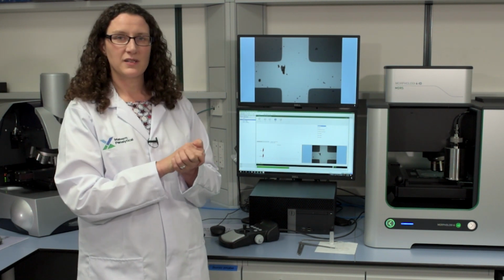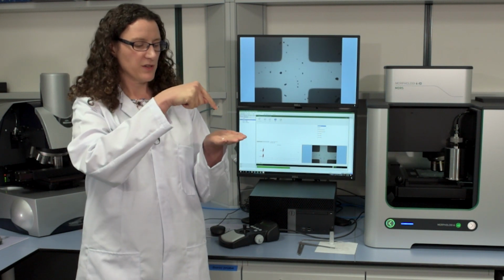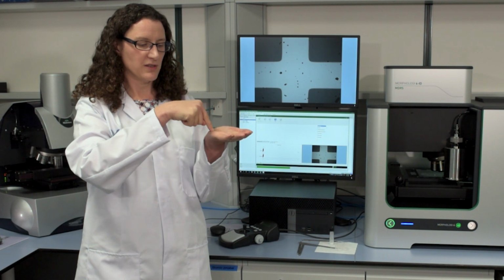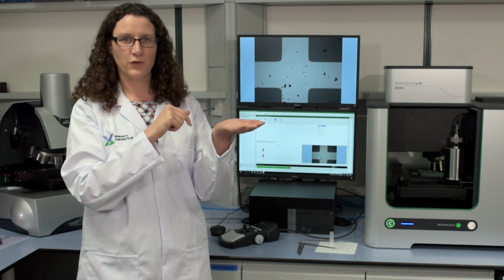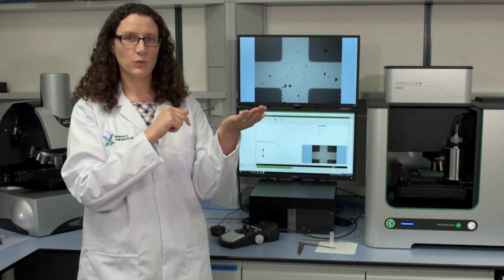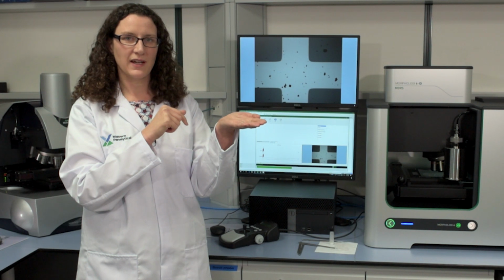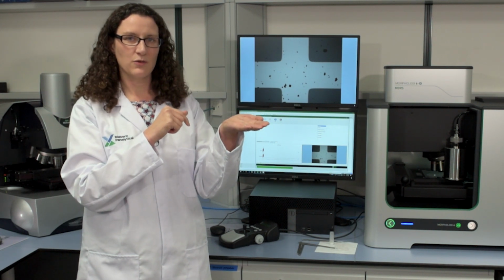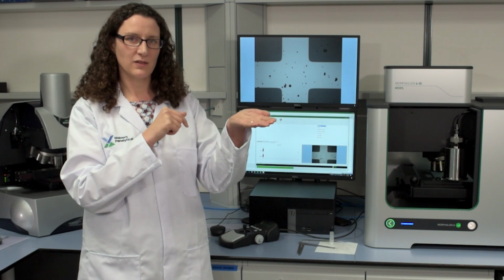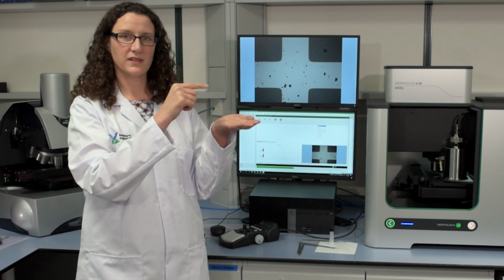The way we do this is by using the crosshair target that's in the top light path, and we focus the crosshair onto 4 different positions on the glass surface. It measures the Z position at each of those 4 positions, and therefore it can work out if the plate is on a tilt. And if it is on a tilt during the actual measurement, it will compensate for that tilt by lifting and lowering the stage as it scans in X and Y to make sure the distance between the plate and the objective is always consistent.